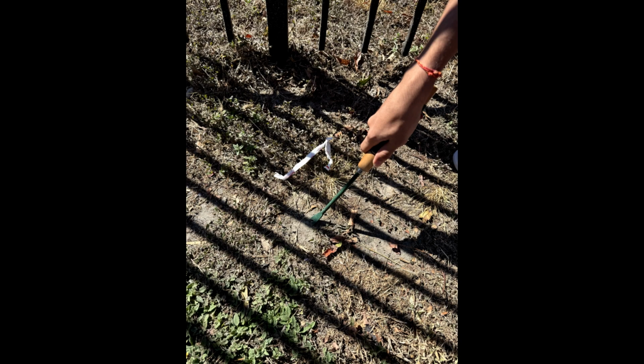Lab. In this experiment, we took a sample of soil from our school grounds and tested the constituents to establish the structure. We tried knowing the textural composition of the soil through the proportions of sand, silt, and clay, and tried finding out how it would affect plant growth. This experiment further demonstrated the process of soil formation, elaborating on how core factors such as weathering and biological activities influence the development of soil over time.